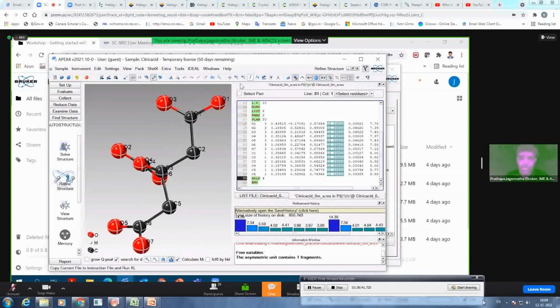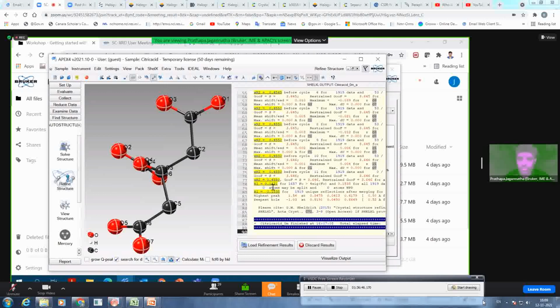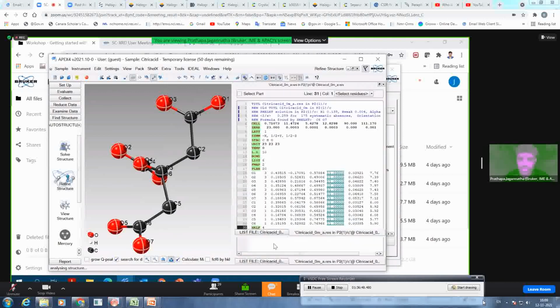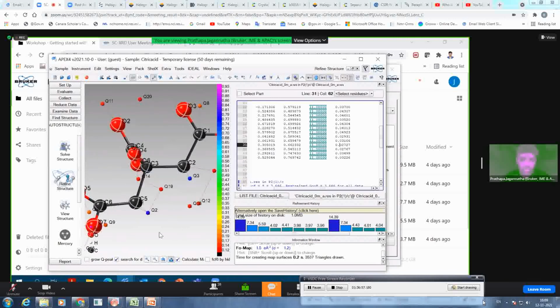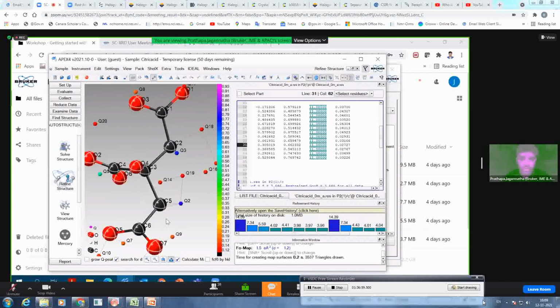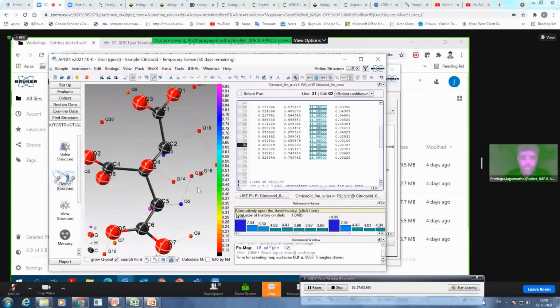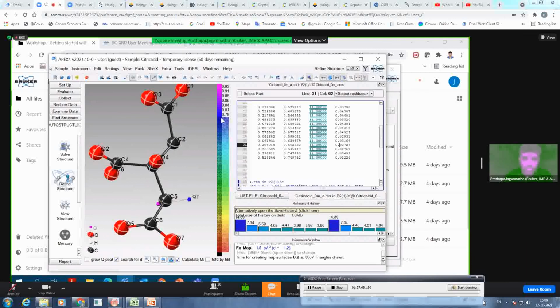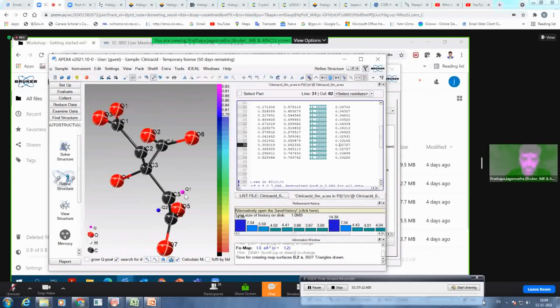So do the refinements. You go to isotropic refinement, starting with 14% with 1.54 as residual density. Load again, and then when you load the refinement cycle, you can see that you get new balls, different colors coming up. These are representing the residual peaks or the Q peaks. You can control Q peaks with this bar on the right hand side if you want to see only a few Q peaks, and then you can see what it actually is.